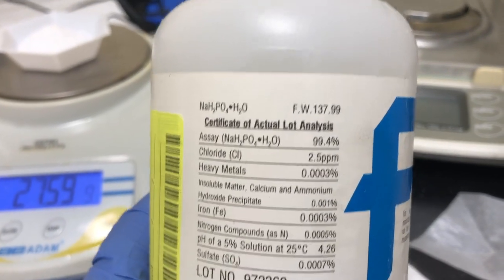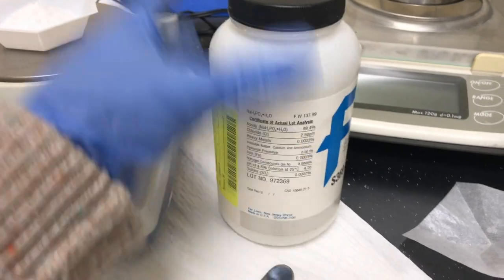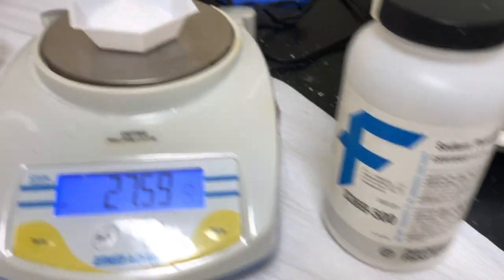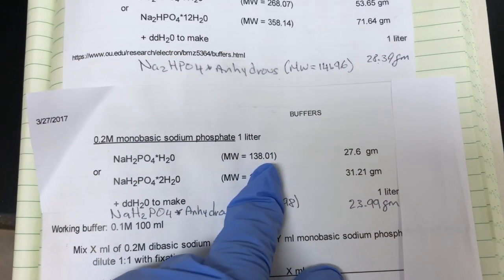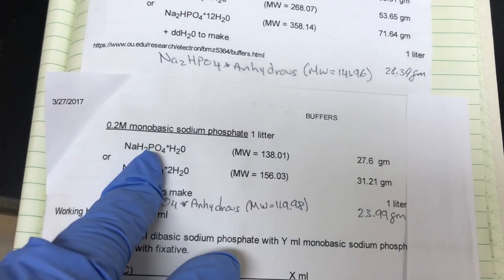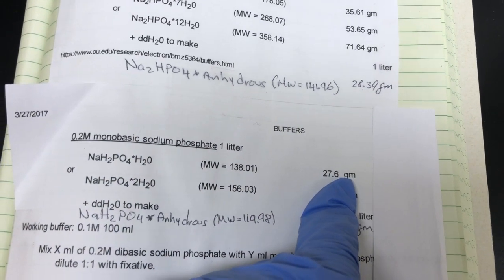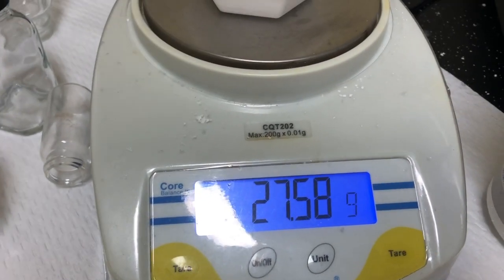So 137.99. With that in mind, we're going to go into our book or any book that you have for that matter and look at the molecular weight, and you're like okay, 27.6 grams, got it. 27.58.